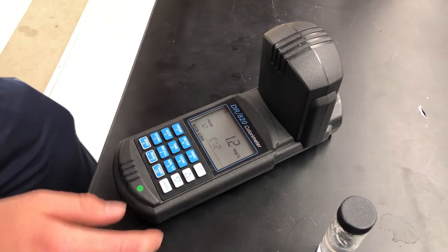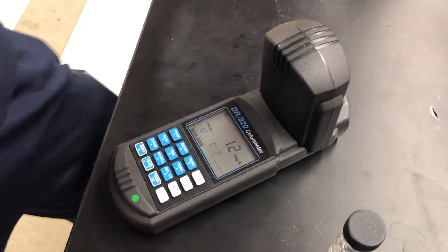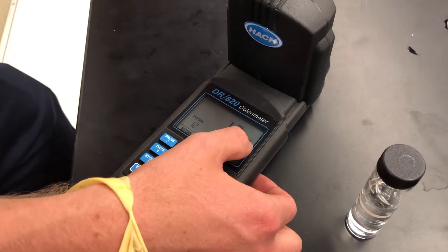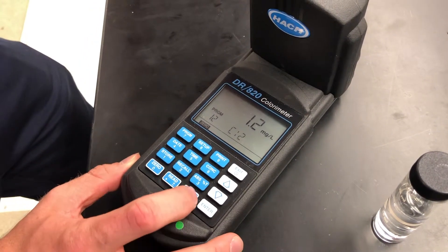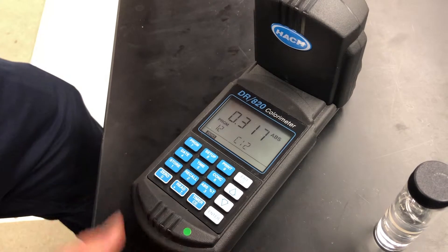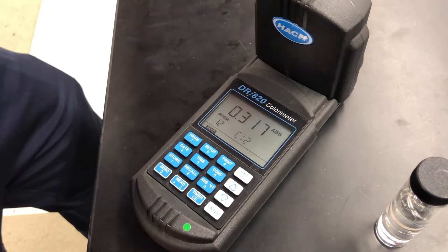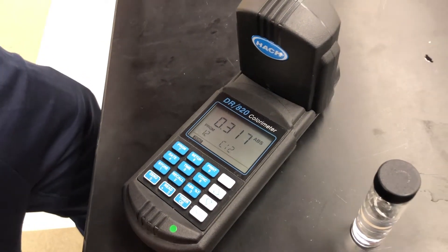Okay, it's 1.2. That is the same, right? Okay. We have a milligram per liter. We need an absorbance. So we have the absorbance button. We have absorbance now. Now we record data.